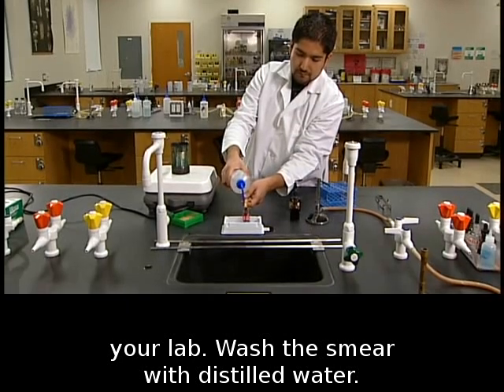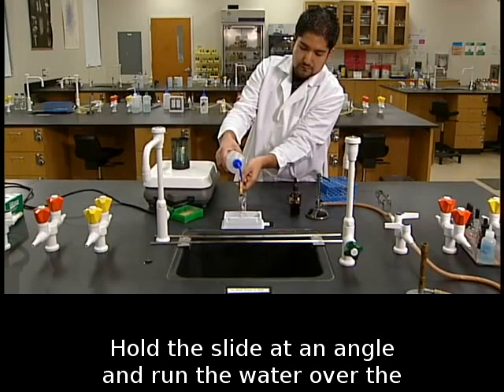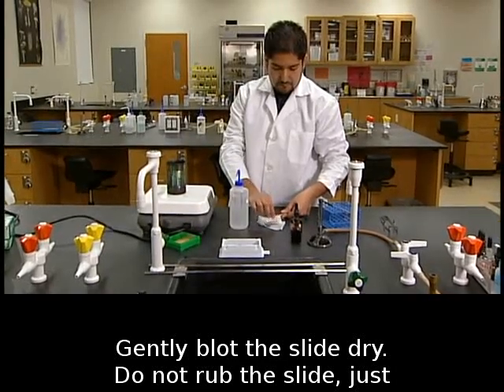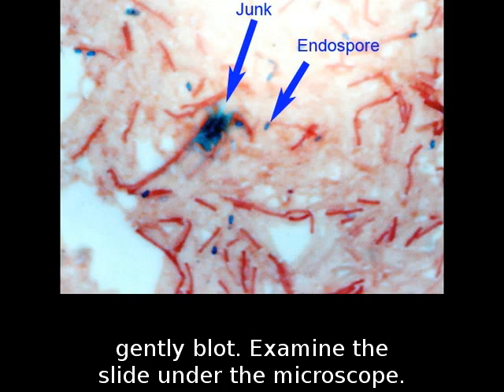Wash the smear with distilled water. Hold the slide at an angle and run the water over the slide until the water runs clear. Gently blot the slide dry. Do not rub the slide, just gently blot. Examine the slide under the microscope.